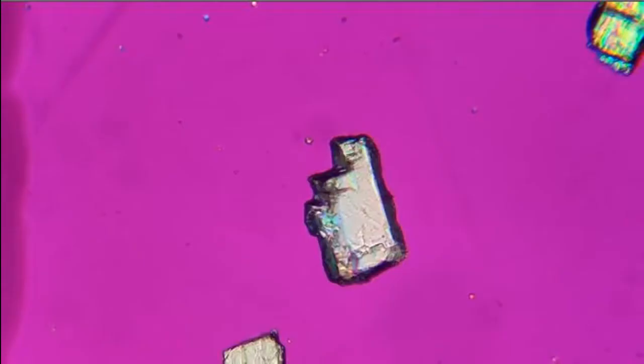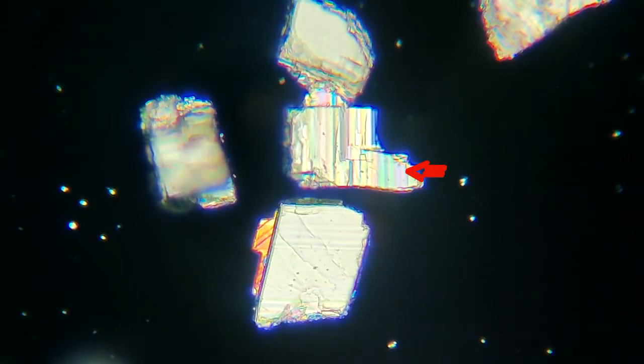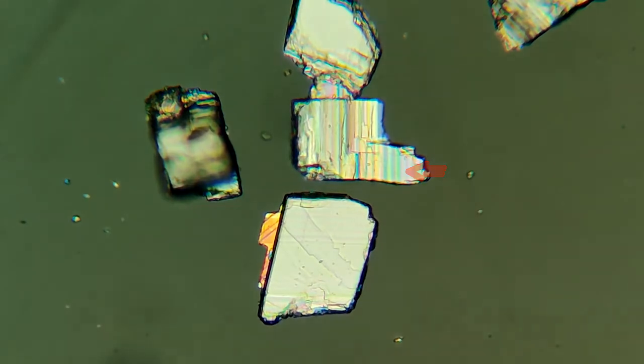Calcite's perfect cleavage also gives rise to a different feature. On cross-section, the crystal can appear to have a step morphology. When viewed from a different orientation, this characteristic can be observed as discrete transitions in the interference colors.